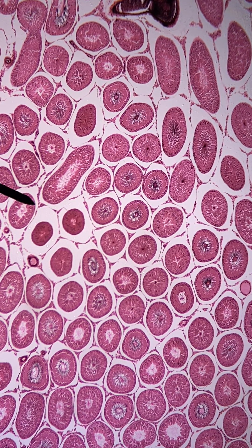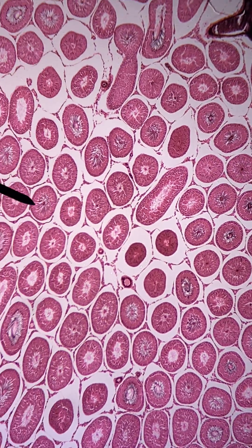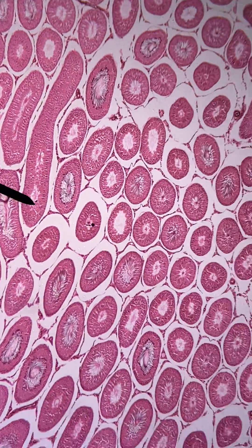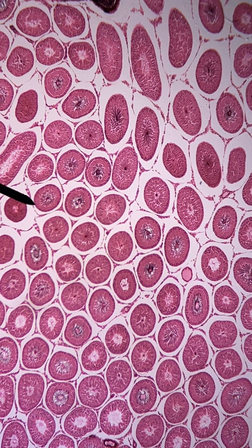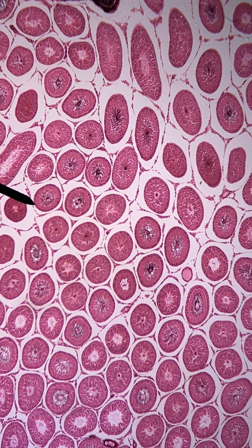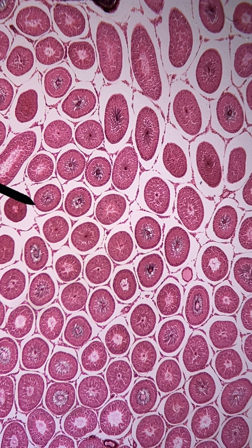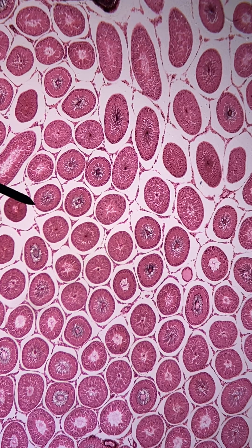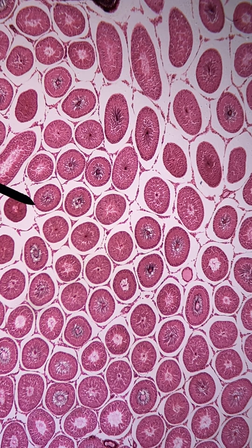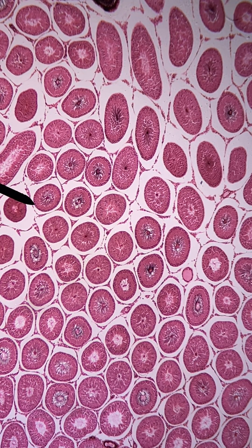I'm going to go back to the low power objective so you can see just how many there are here — this is just one section through a single testis. Lots of tubes. These tubes are mostly connected; they go back and forth in and out of the screen here. When the sperm cells are finished here, they go to the epididymis where, among other things, they become motile — meaning that they can swim.